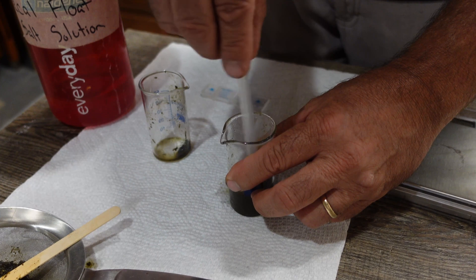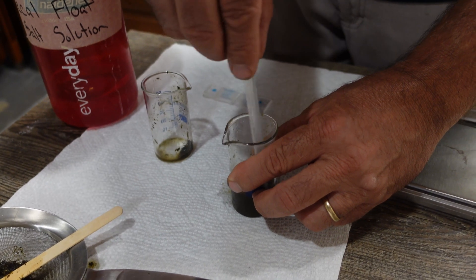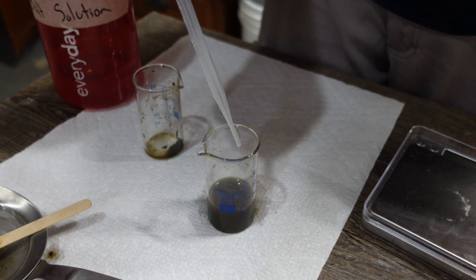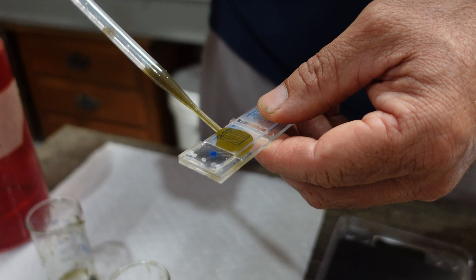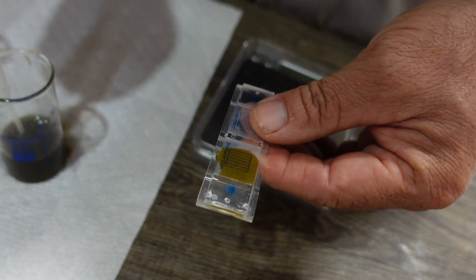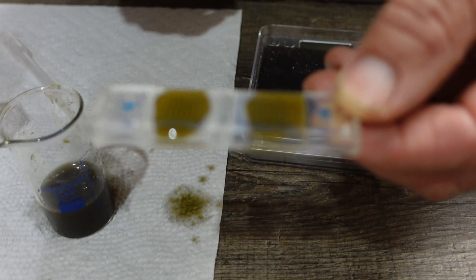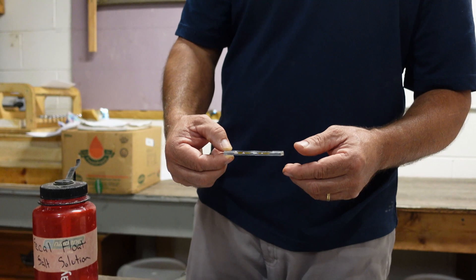I'm going to take this pipette and stir it around for a few seconds. Then I'm going to draw off the top of the salt solution to fill the slide, because the eggs have a certain amount of weight and with this salt solution they float — so the eggs are going to be at the top. I'll depress the pipette, put it in, suck it up, and fill up the slide. As long as I have those grids covered I'll repeat that process for the other side. Now I've got the two sides filled, all the grid lines are covered, no air bubbles. We'll give it a minute for those eggs to float up, then put it on the microscope.